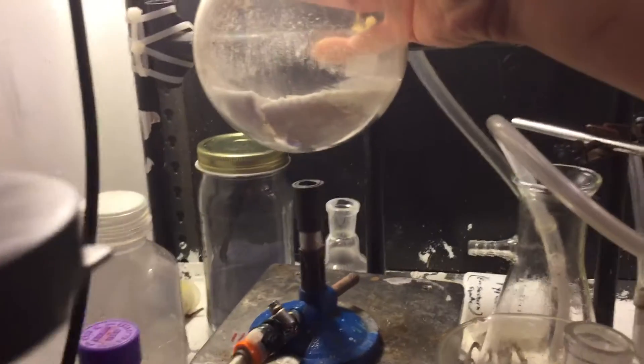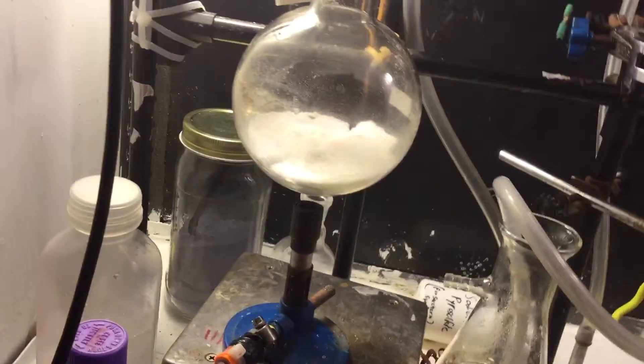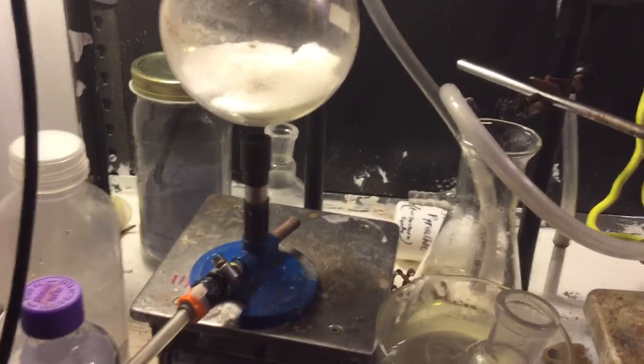And I think I warped the flask slightly, ever so slightly, not too much.